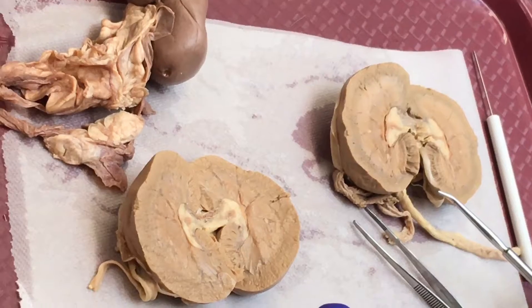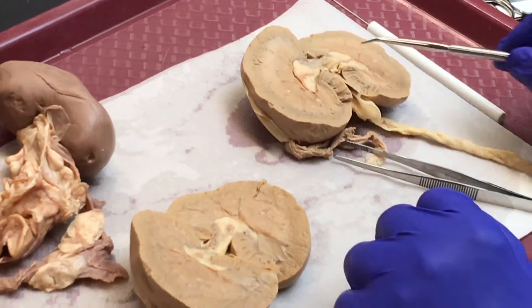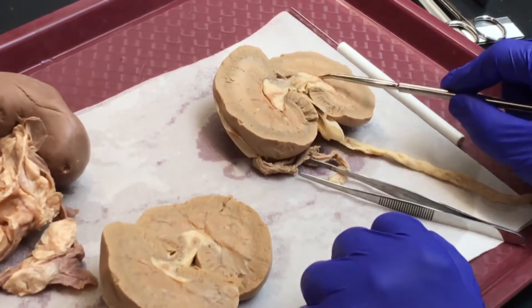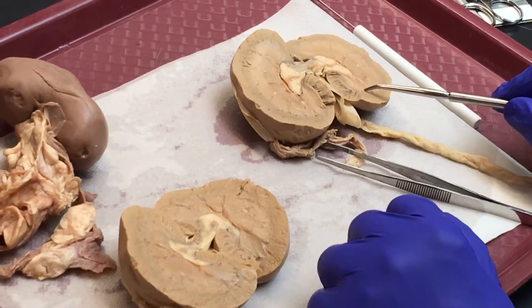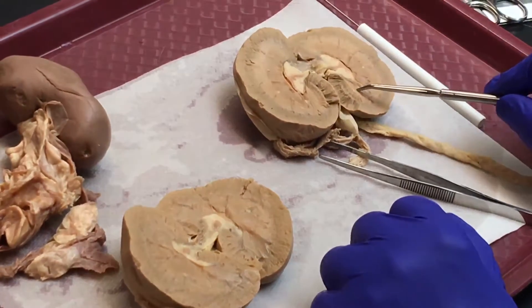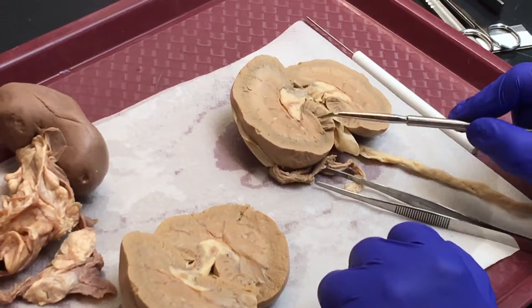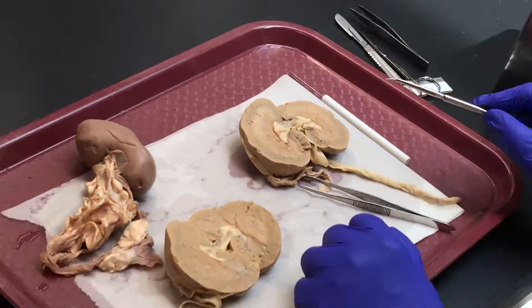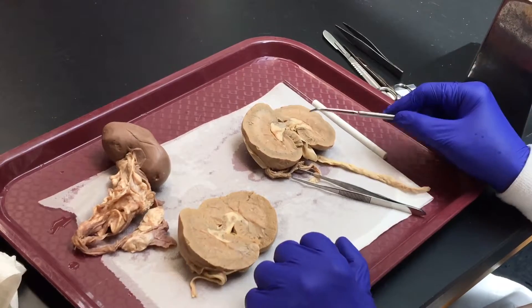And you should be able to identify: capsule, pelvis, sinus, renal cortex, renal medulla, renal pyramid in the renal medulla, renal column, and renal papilla.